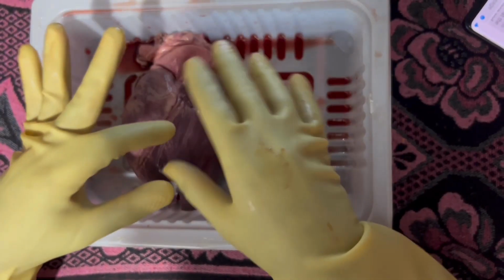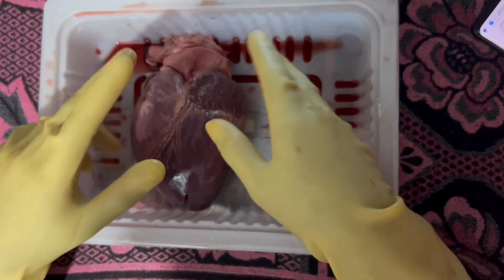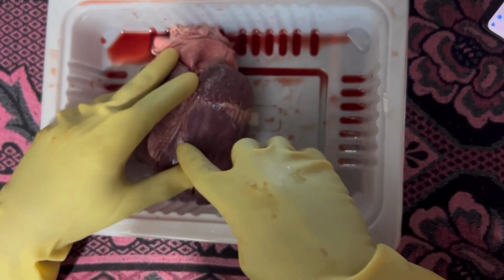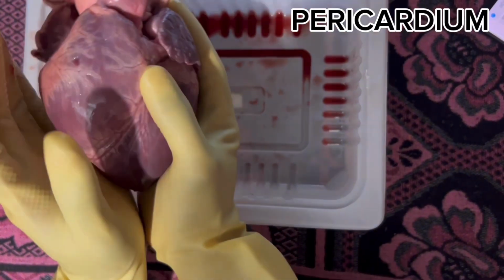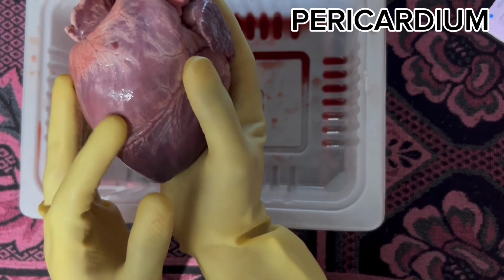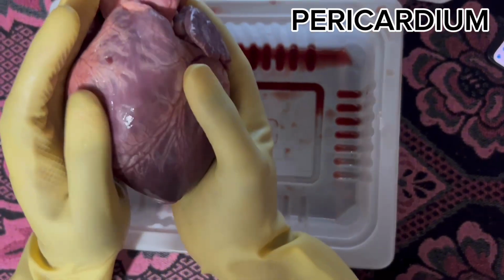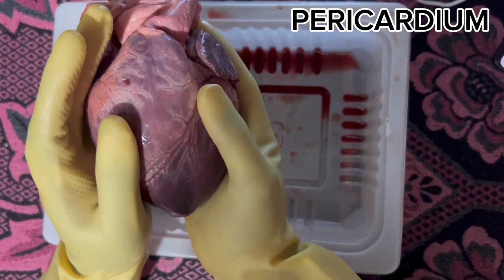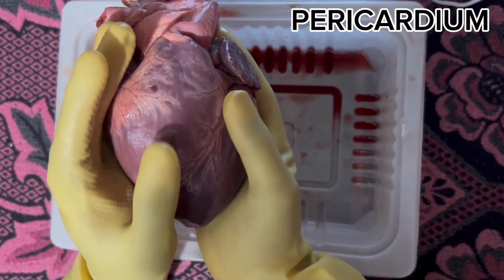So first, we're going to identify the external parts. First is the pericardium. So this is the pericardium. The pericardium acts as mechanical protection of the heart and big vessels, and the lubrication to reduce friction between the heart and the surrounding structures.